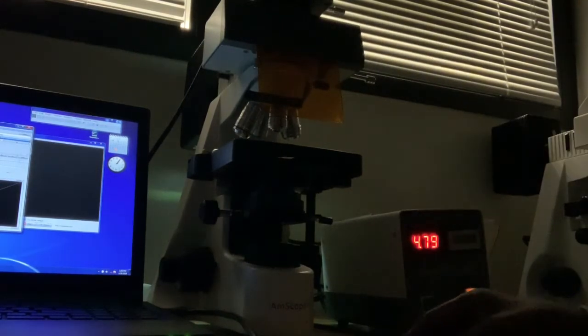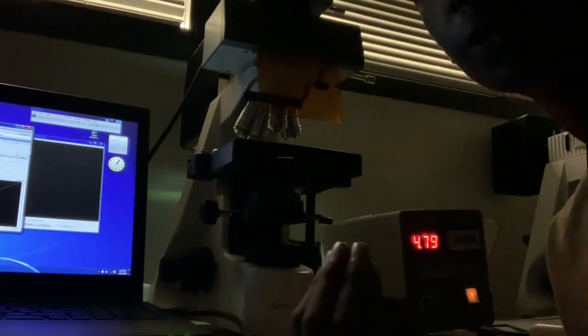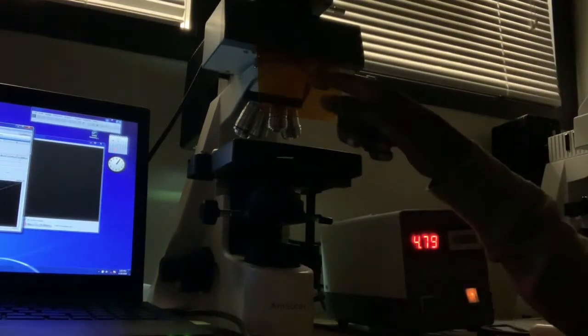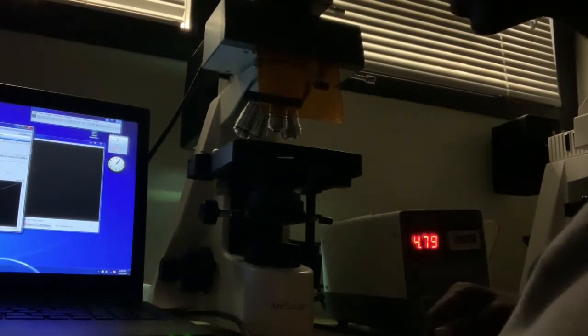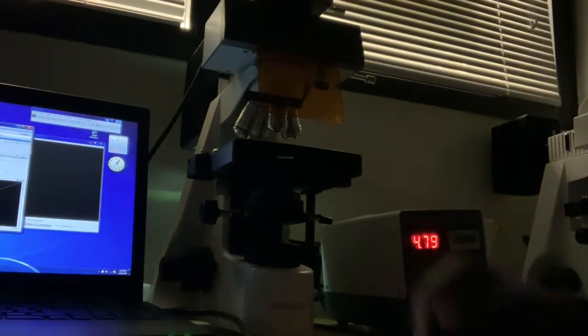And just for your viewing pleasure, I have a slide. It has fluorescent beads from a project this year. And I'll show you how to basically get it. So first off, you obviously just want to put in the little slide holder right here. These beads are fluorescent with blue light. So obviously when I'm doing all the observations, I should be looking through this orange visor, like I said before, since I don't want to get any eye damage.